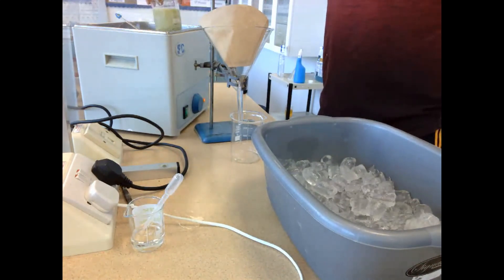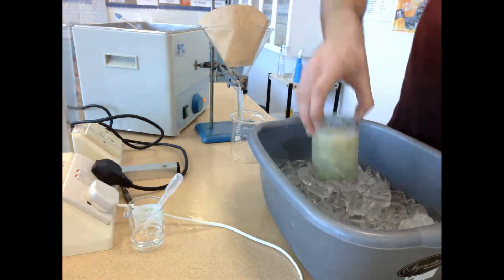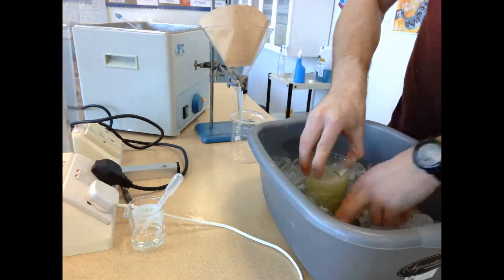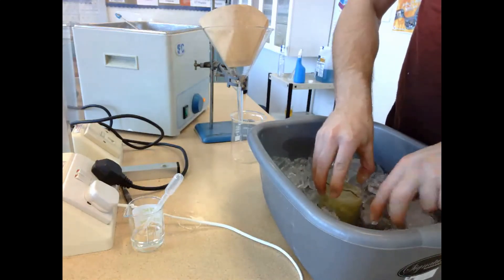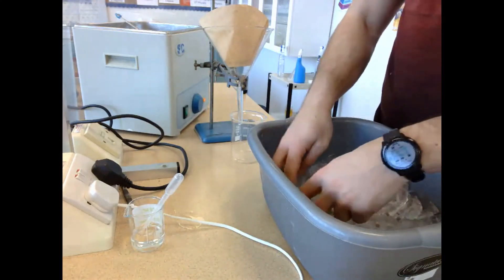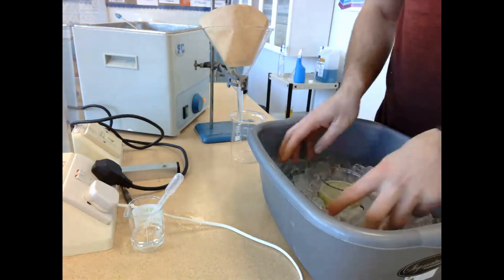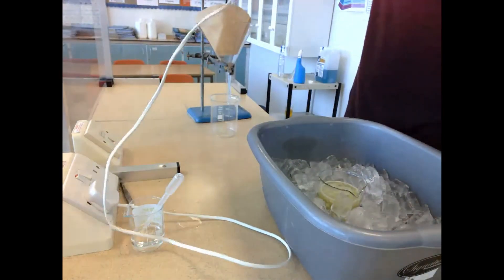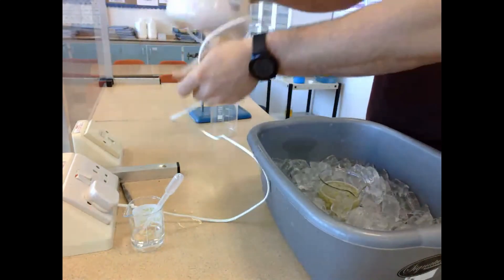Once it has been in the hot water bath 15 minutes, we then take it out and we place it into an ice bath. We place it into the ice bath to ensure that the DNA doesn't have time to denature. And then what I'm going to do here is I'm going to pack the ice in really tightly around it to bring this temperature down pretty quickly.